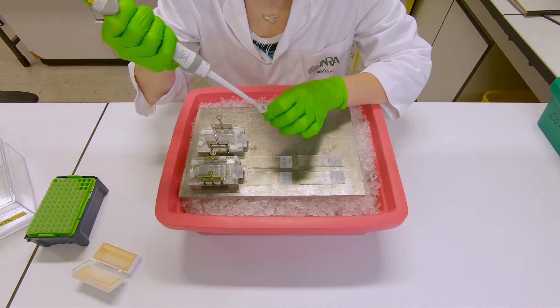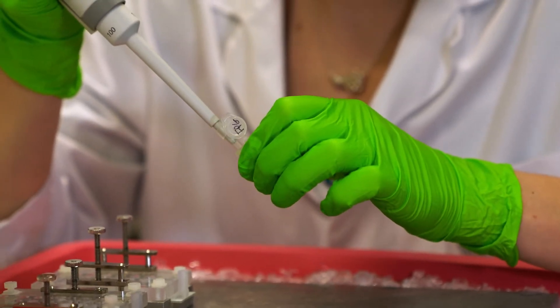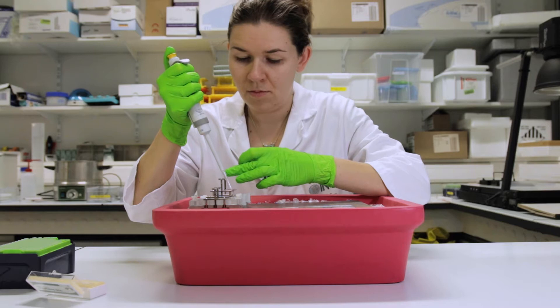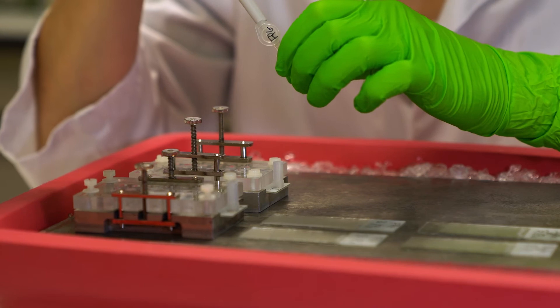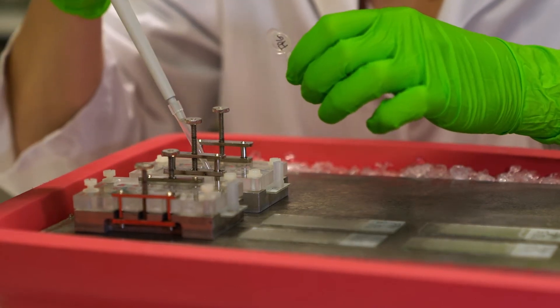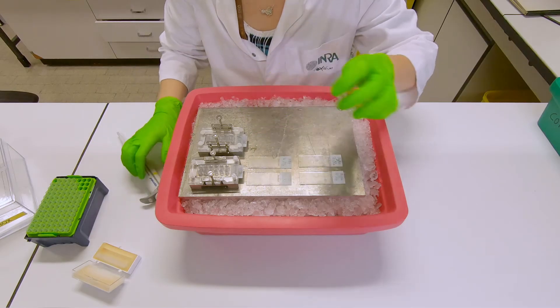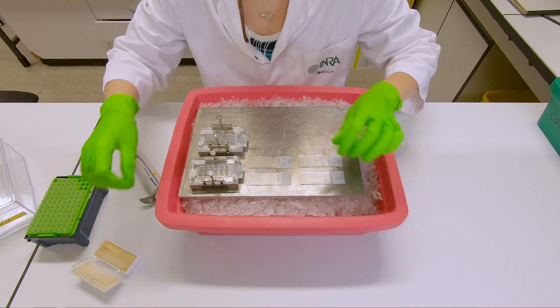Adding the enzyme and the reaction buffer in cold is done to avoid the reaction from starting. When finished, add a coverslip on top of the wells.